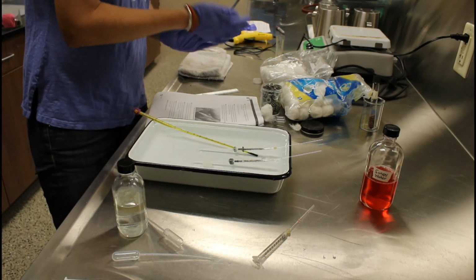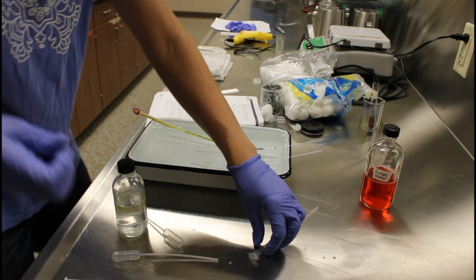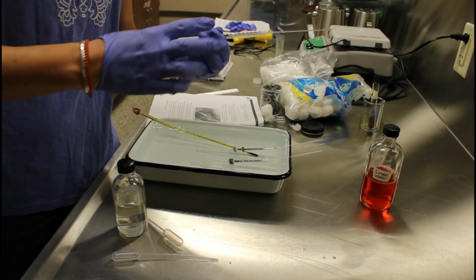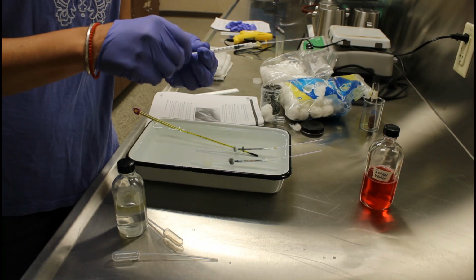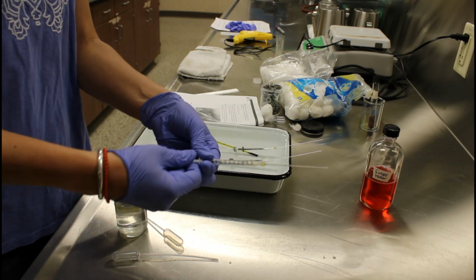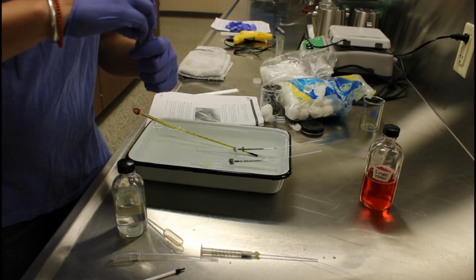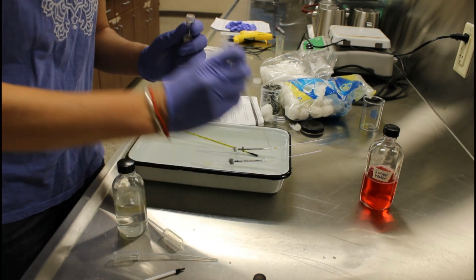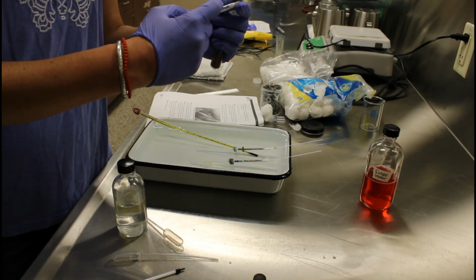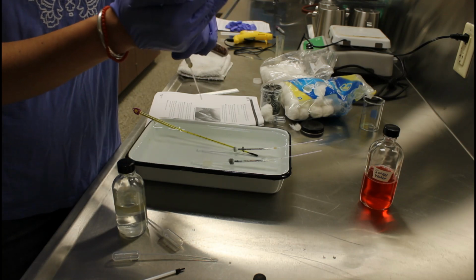But we're going to have living organisms inside this barrel, and they might be harmed by the KOH. So I'm also going to throw a little plug of this non-absorbent cotton in here. It's not going to absorb the KOH. This is just a little plug to protect the organism that we're going to put inside of here and measure its respiration. The organism is a plant. We're going to use radish seeds, and I'm going to put half of a milliliter. So I'm going to put the seeds in here volumetrically. I'm going to put half a milliliter of seeds inside my micro respirometer.